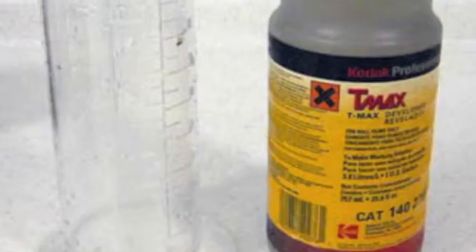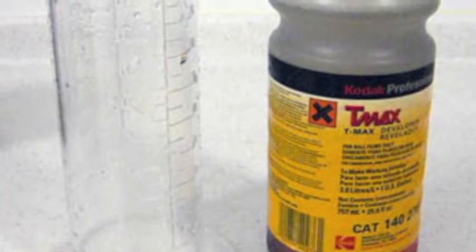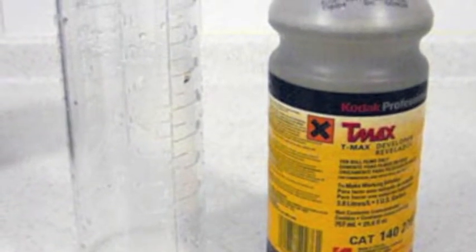This lab experiments with the gelatin-silver process of developing black and white film. This process was very important in the 19th to 20th century because during this period it was the only form of film processing available. Therefore, if someone wanted a photograph, they had to understand and undergo this process. This gelatin and silver process was also very important because it allowed chemists to experiment with these chemicals and therefore further understand chemistry on a deeper level.